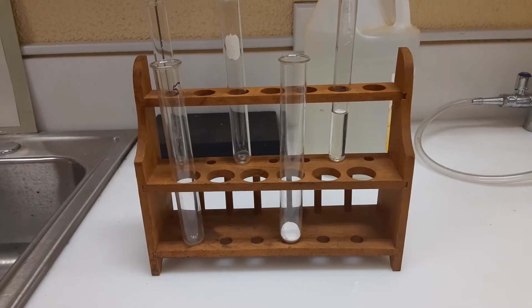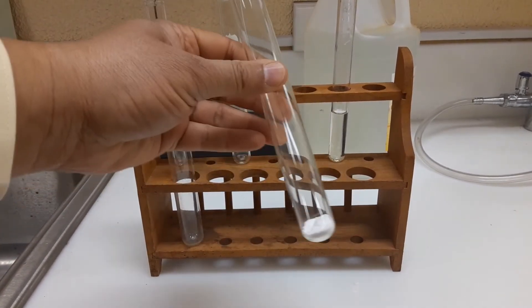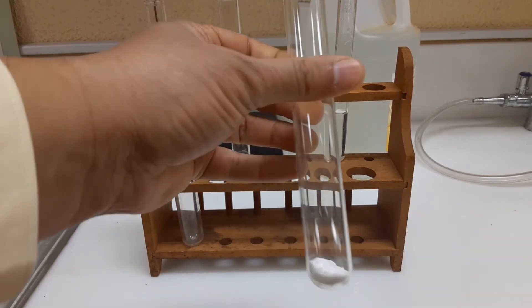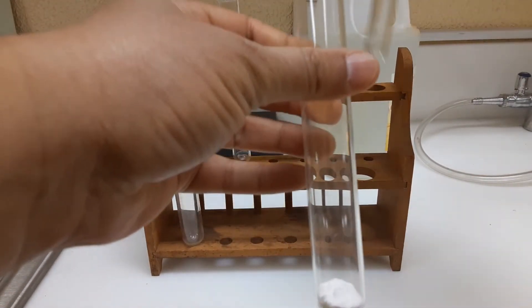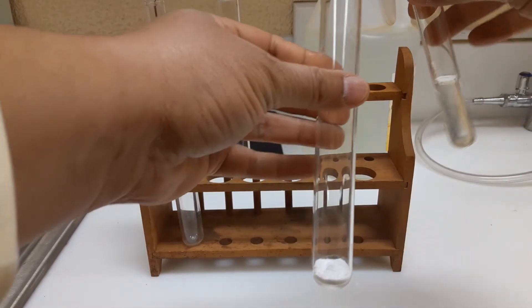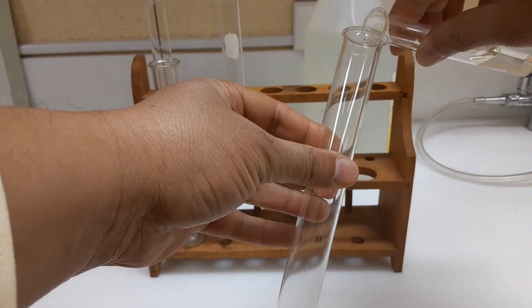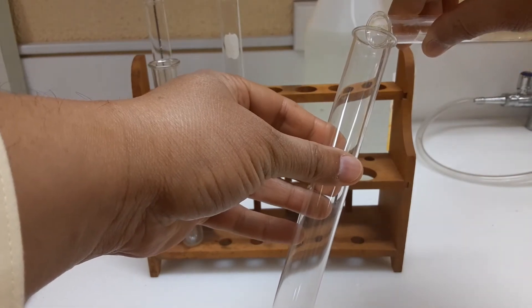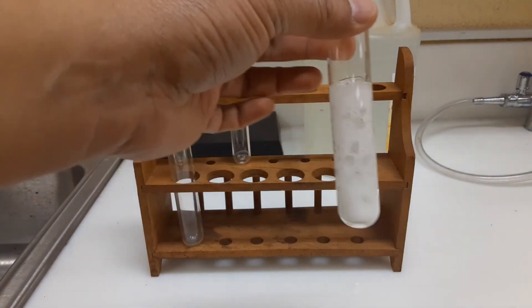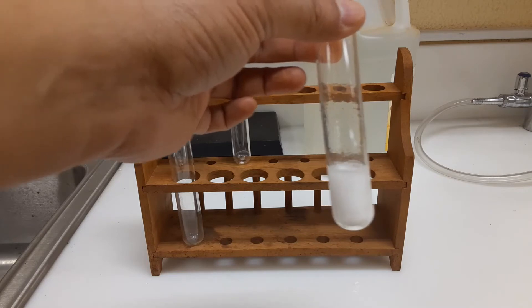For this next reaction, we have some baking soda — a staple of all chemistry classes. We have a test tube with some baking soda in it, and the other test tube has some plain old vinegar in it. We're going to mix them together and see what happens. Here goes the vinegar inside the baking soda, and as soon as the vinegar goes in, you can see that there are a lot of bubbles being produced.